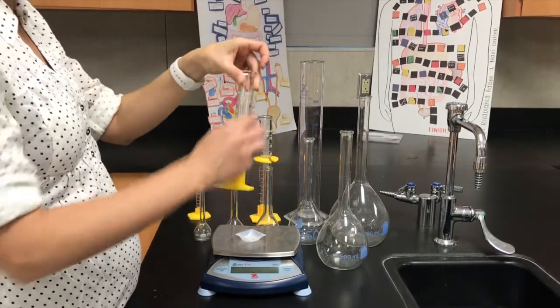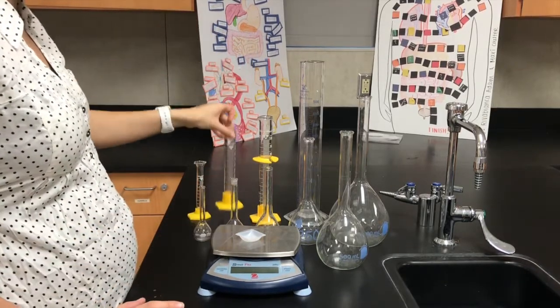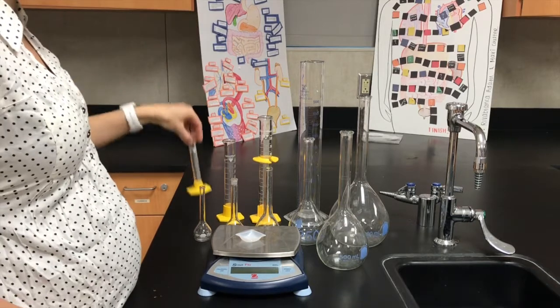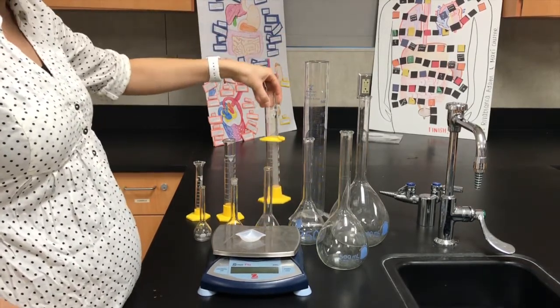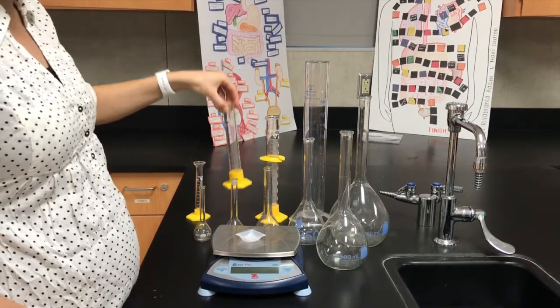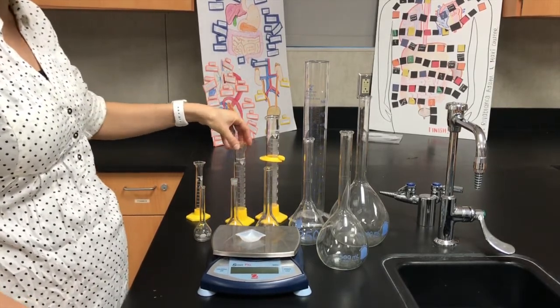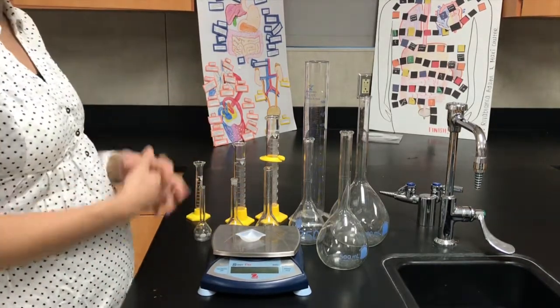So I would put the solid in there and then add it until I got a final volume of 30 milliliters. Don't add water 3 times here or use a ridiculously large graduated cylinder when you have a graduated cylinder that has a final volume that is closer to what volume you want. So that's the first type of creating a solution, taking a solid, making a solution from it.